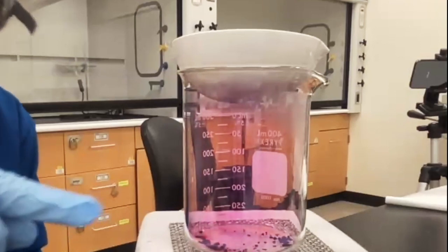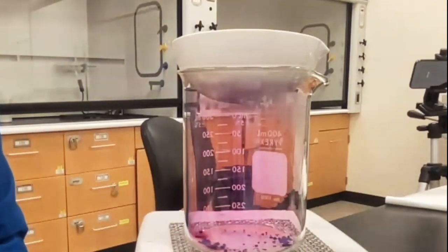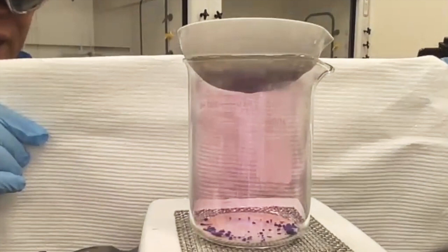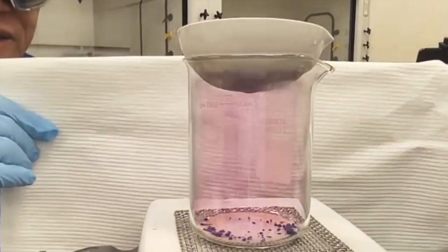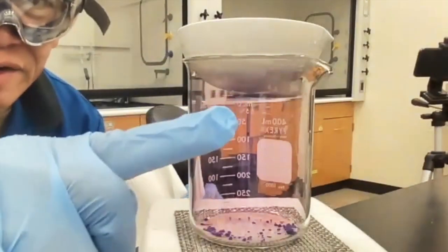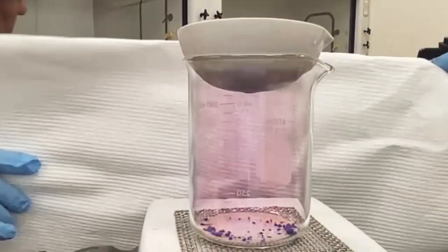You can see the purple gas starting to dance down here. And then as that chemical starts to go into the gas phase, then there's less gas because there's less chemical to do the sublimation. And notice the other chemicals are there as well. Now the purple gas is clearing up, and that's because it's all collected at the bottom right here, okay? All collected at the bottom right there.